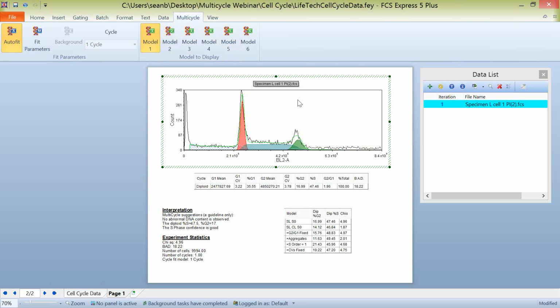But you do want to go through and review that data carefully and make sure that it makes sense. Now, along with the different model types, there are different cycles that can be analyzed in our cycle tab here. You can see when you're actually using the full version of Multicycle like we're using now, you'll have access to more than just the one cycle that comes for free with the software. You'll be able to come through and look at overlay peaks, try and calculate an apoptotic peak if one exists, aneuploids, 2-cycle, 3-cycle, as well as synchronous S phases.